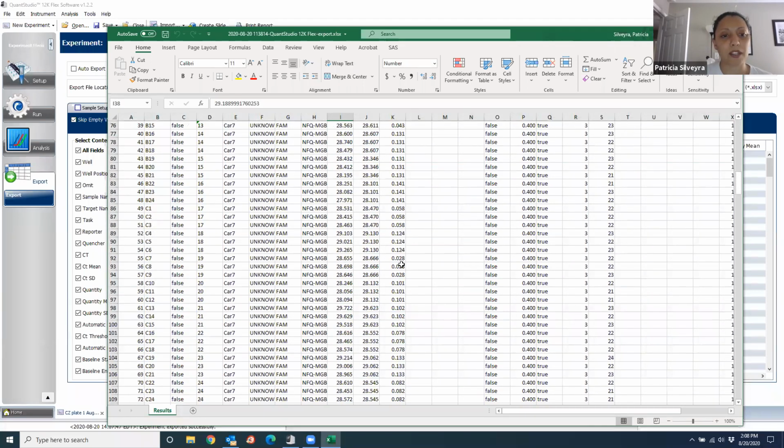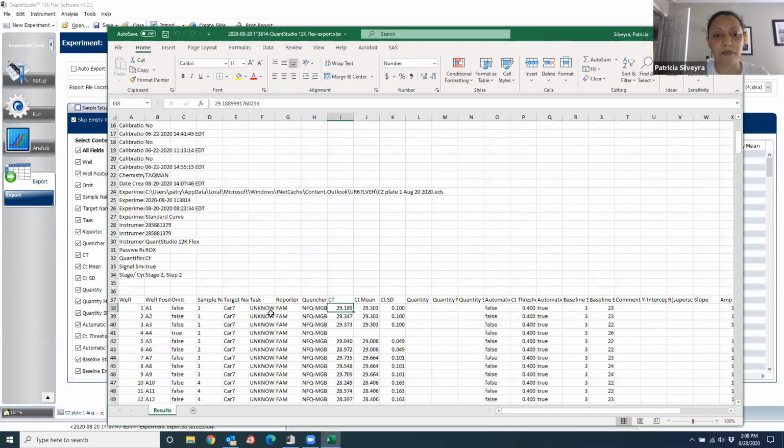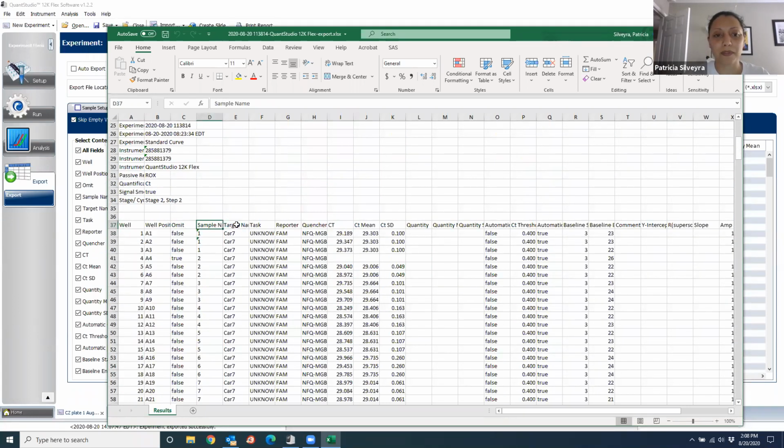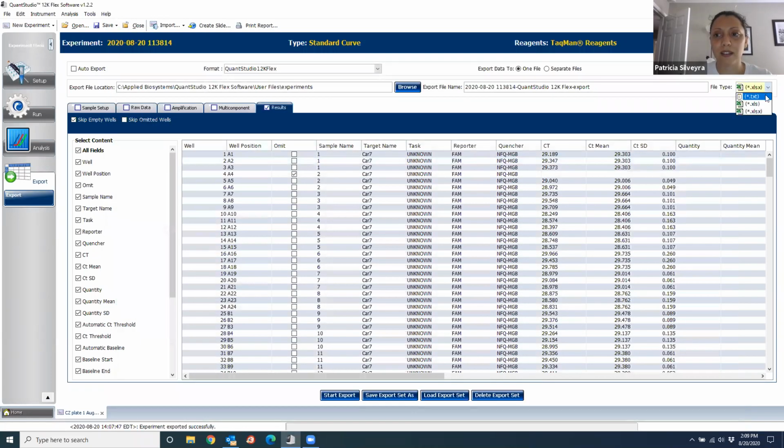So I can explain in another video how to do the analysis, but what I agreed with the PI is that we were just going to send them the CT value. So what you're going to report to them is this Excel file, or you can just create a table with the sample, target gene, and the CT only, and everything else you can get rid of because it's not important. All right, so this is how it looks as Excel, and this is how it looks as text.